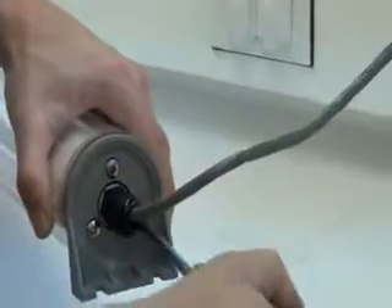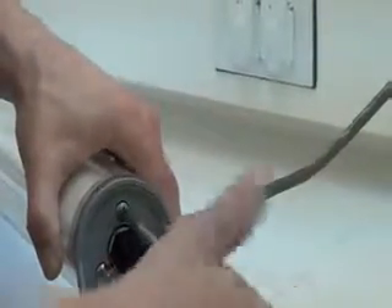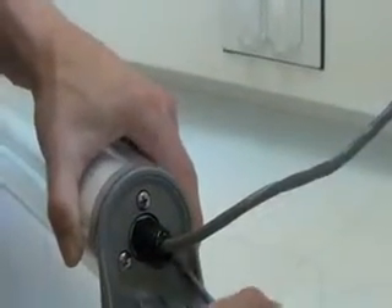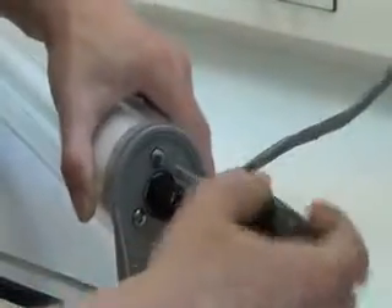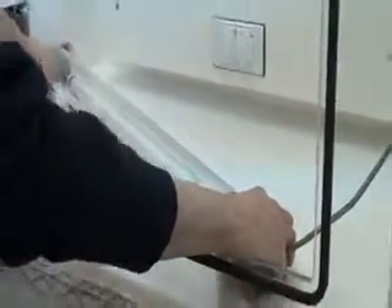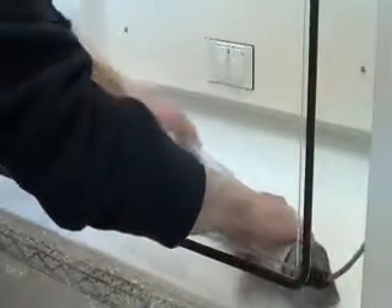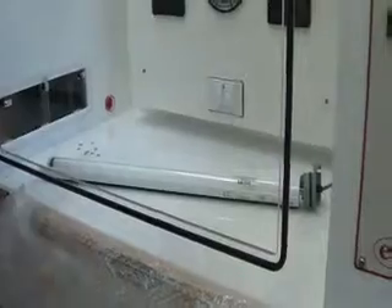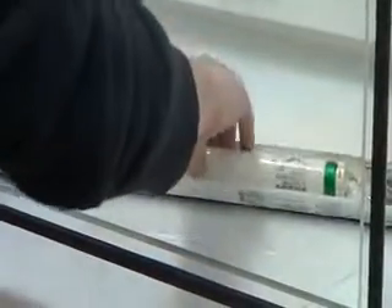Just a couple of turns each at a time as you loosen the screws — you'll see the tension come off the O-ring. That frees out this end. Now slide out the light tray, being careful not to scratch it against the surface of the acrylic tube. Then remove the little metal piece, which exposes the light bulb. Simply turn clockwise to pull out the bulb.